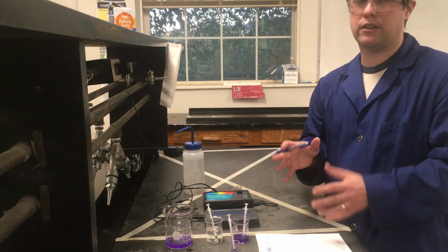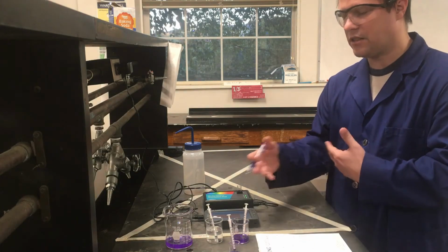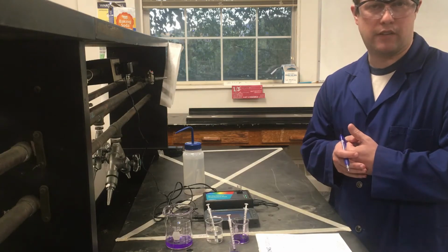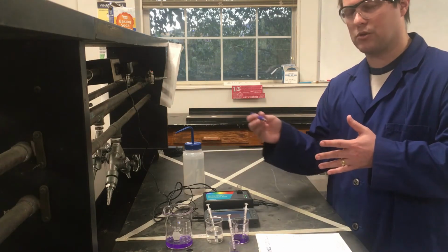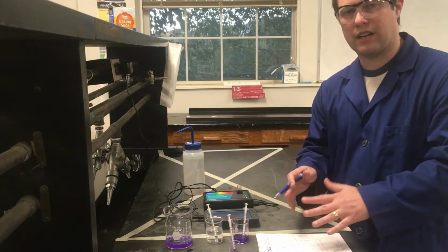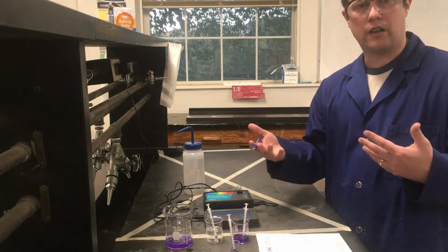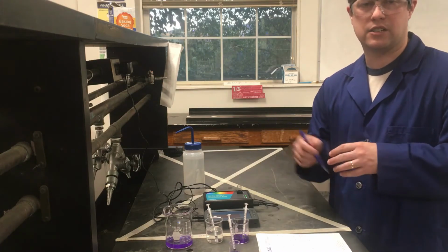And rather than make you sit here and watch me painfully measure out each one, I'm basically going to repeat this for the rest of our concentrations, just writing down the absorbance. And that's all we're doing for the whole second part of this experiment. I'm just writing down these absorbance values. At the end of the lab, I'll have an actual table of data that I'll show to everyone and record, so you can see all the data and those measurements that you're going to need to get your calibration curve.